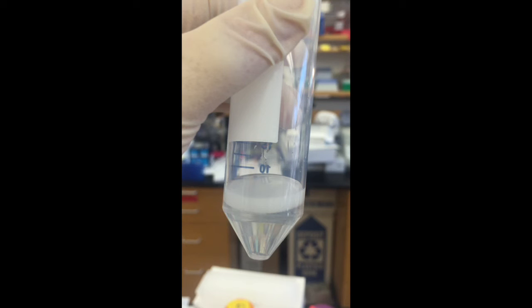But when you're all caught up in the experiment and things might be kind of cramped in your setup, it's difficult to really tell for sure if your droplets are uniform. So the rock method really does seem to be the best way to do this.